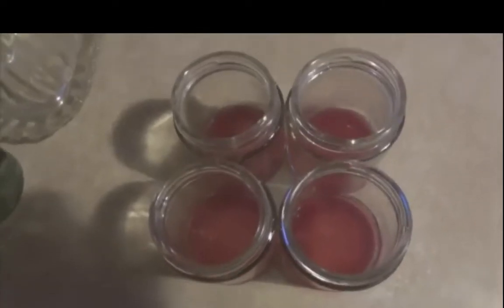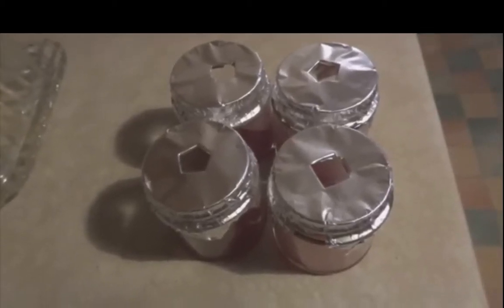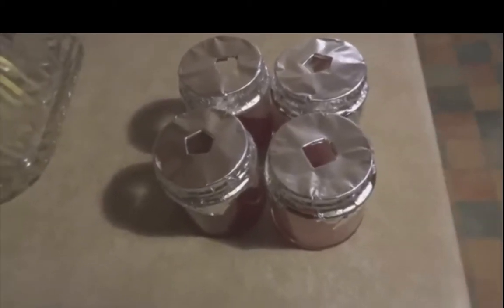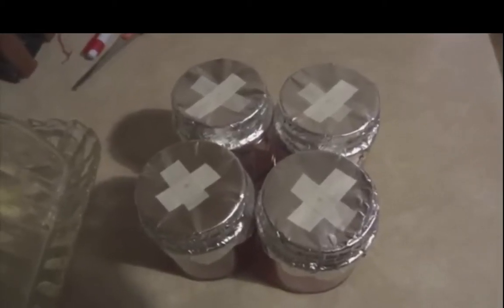This is then dispensed into jars, not agar plates, because pouring agar plates requires you to have a very sterile place to do it in, like a laminar flow hood, and I only have a still air box. The jar lids are then covered with foil with a hole to minimise the contamination window, then covered with another layer of foil, and then 2 layers of micropore tape. This allows the culture to breathe.